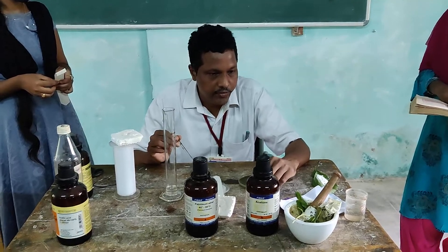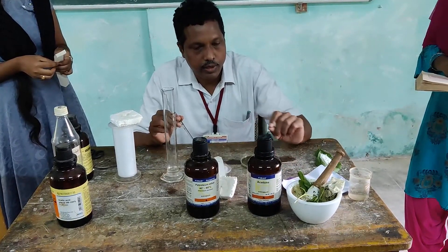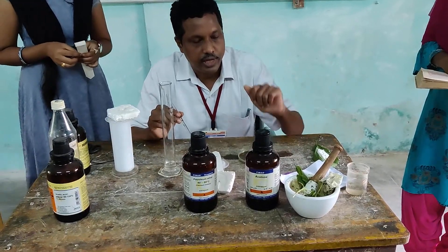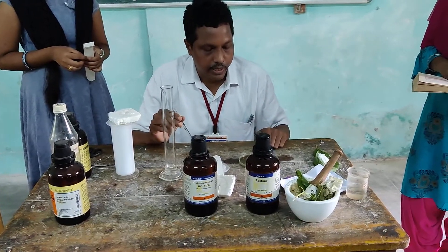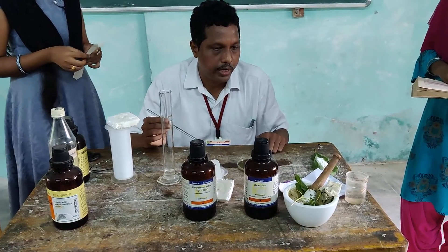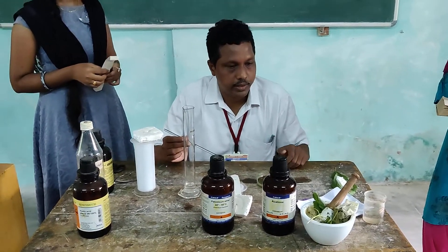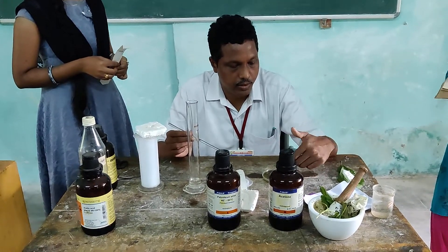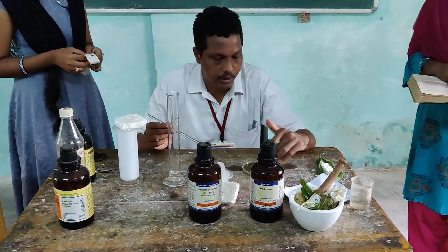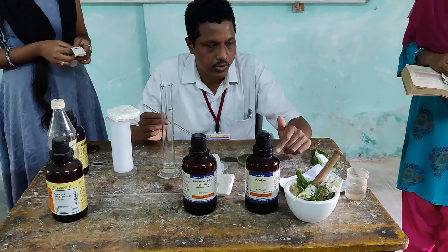We choose fresh leaf extracts — we use a new, fresh leaf. The paste is also made with sand, calcium carbonate, and alcohol. We mix and grind these together.